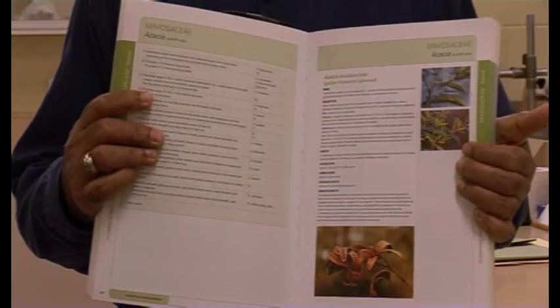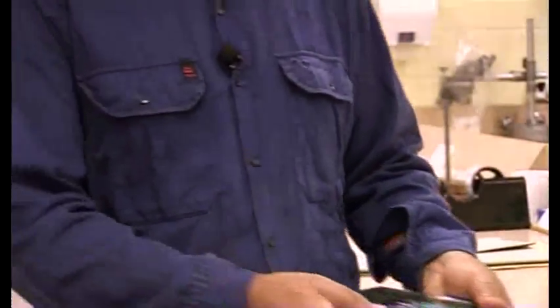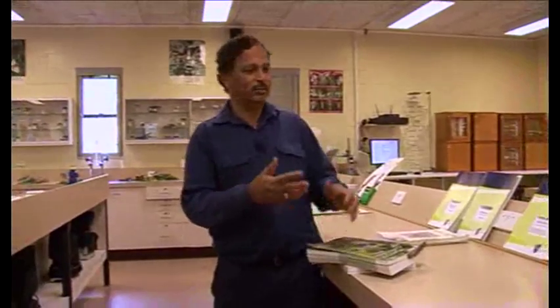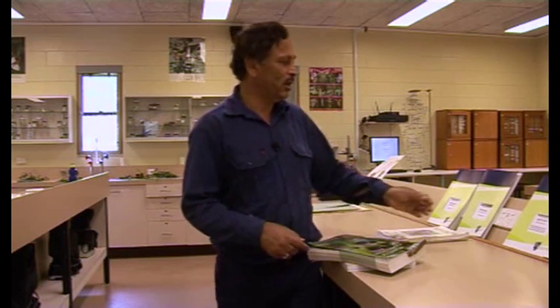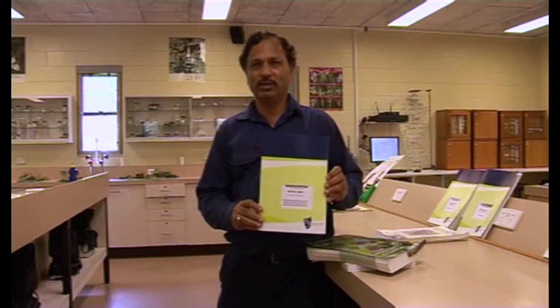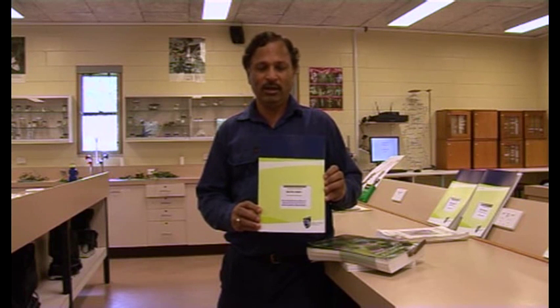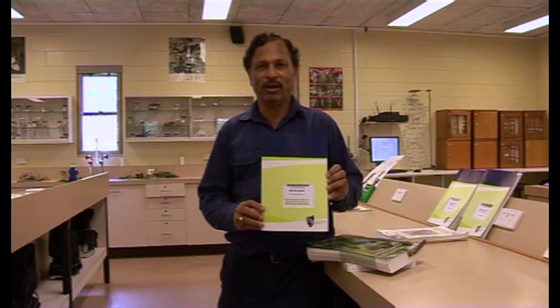Once you know the name, then you need to prove that it is the real specimen. You need to provide the proof to say that this belongs to this particular genus and this belongs to this particular family. The only way you can prove that is to dissect and collect the information, and put that information into this manual called the Plant Identification Manual.